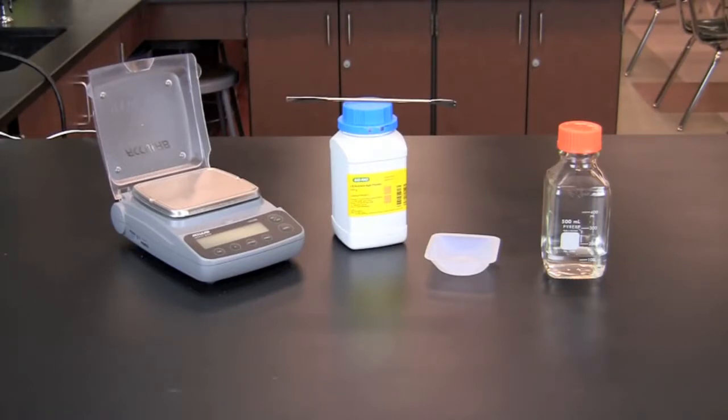Bacterial cell cultures require growth media. A common medium for culturing E. coli bacteria is lysogeny broth, which is also known as Luria bertani broth and is commonly referred to as LB broth. In this video you will learn how to make LB agar with ampicillin and arabinose.